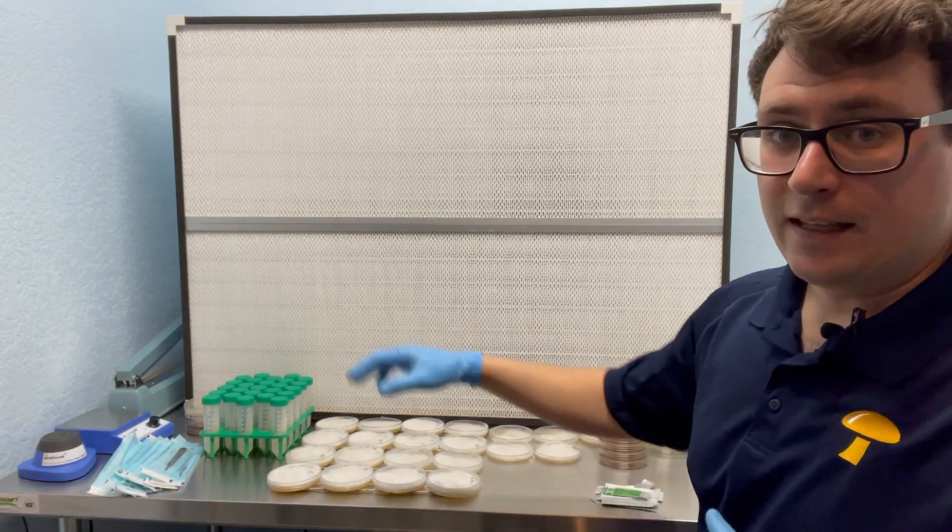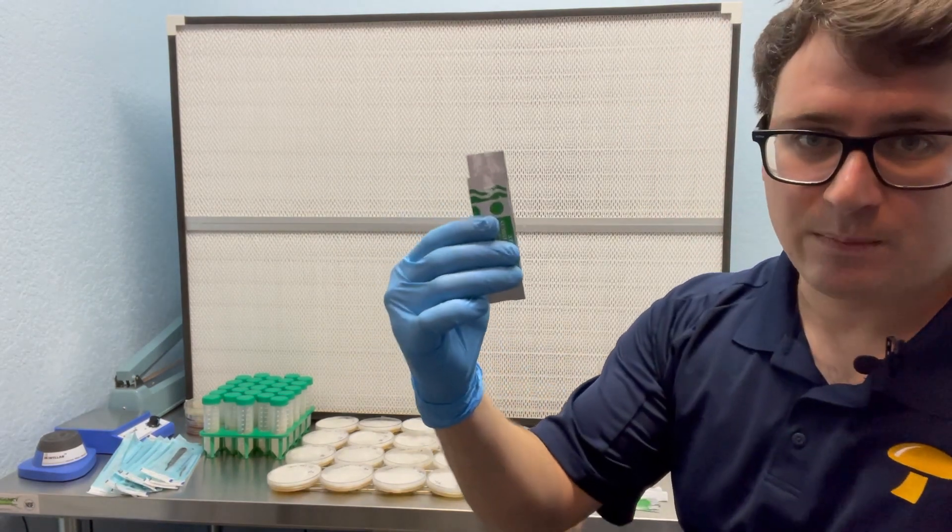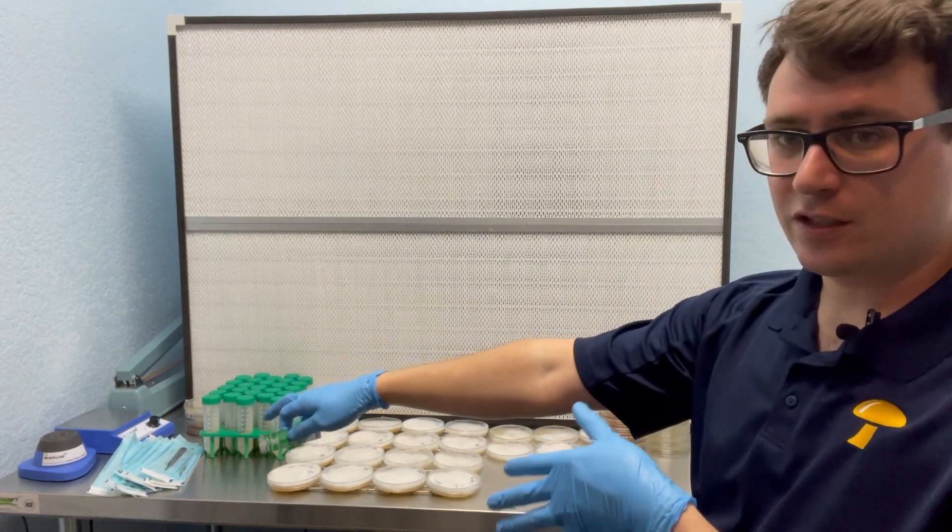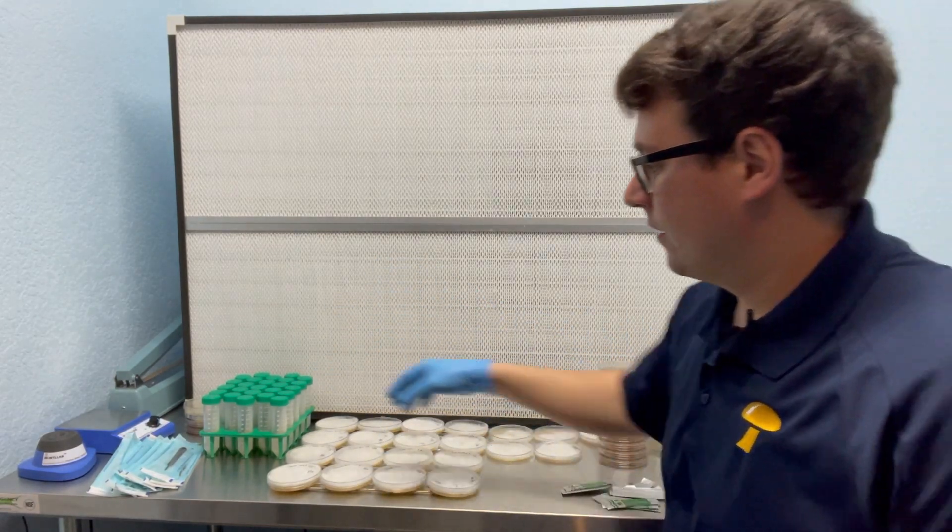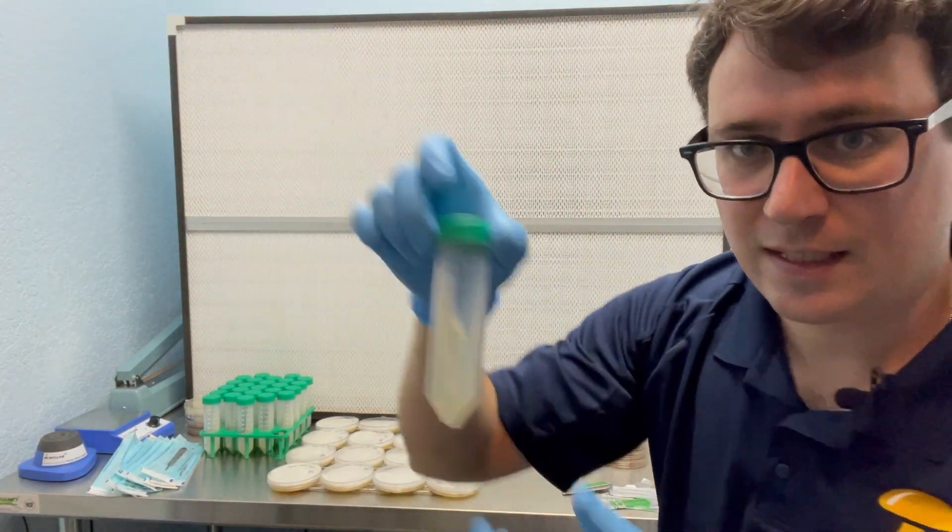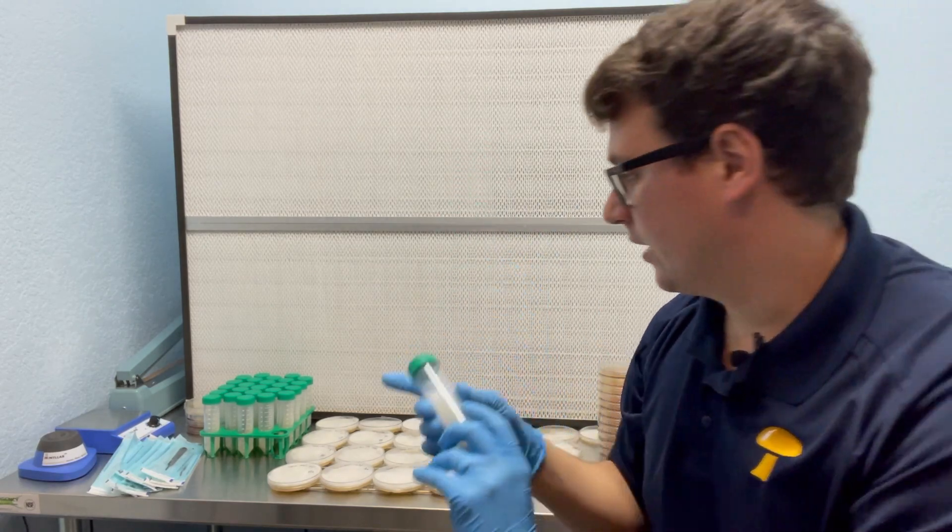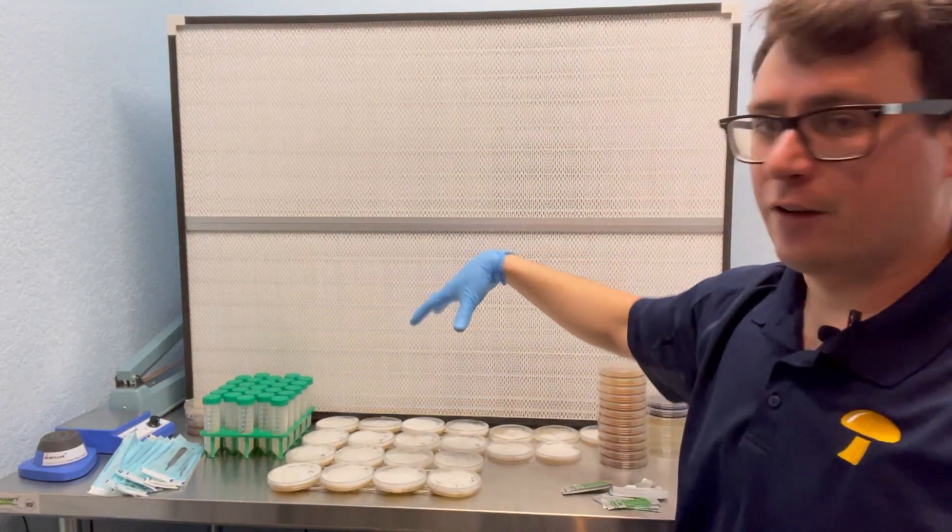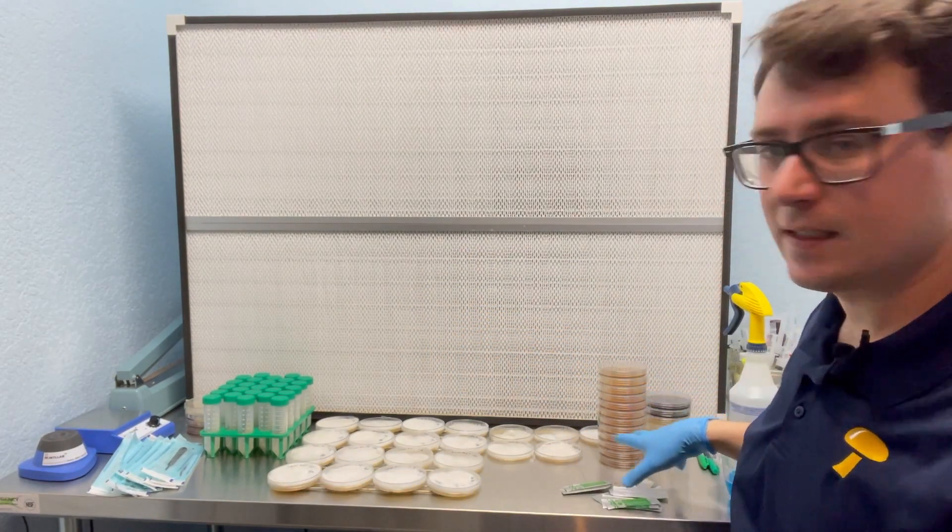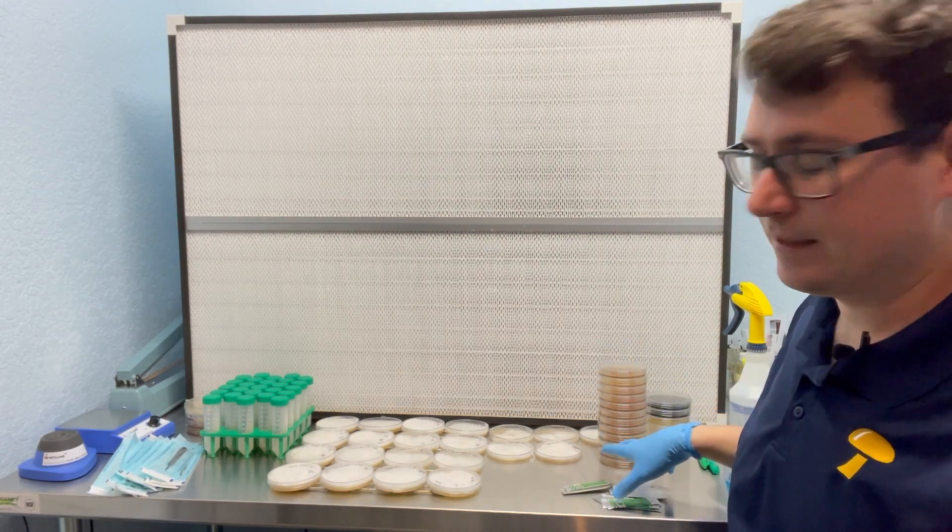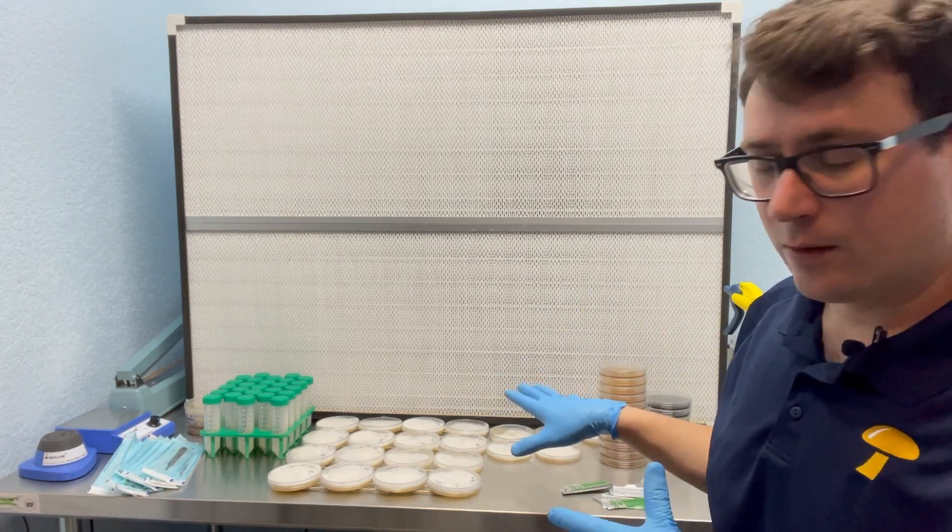I also am usually a little bit more lenient when it comes to reusing blades with the same species of mushrooms. However, these are all different phenotypes so I'm going to use a fresh sterilized blade and a freshly sterilized blade handle for every single plate because I'm going to be storing them on generation one slants. So that in the future I'll have the original mother culture from all these different phenotypes. So that's kind of my setup here. I've got mostly MEA or malt extract agar plates. I've got a couple black charcoal and potato dextrose, it's just what I had laying around.